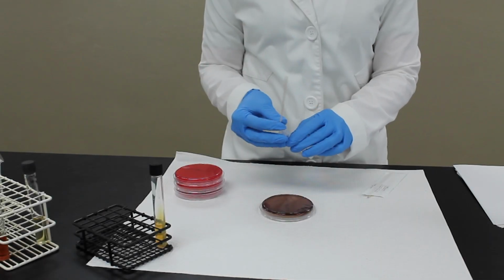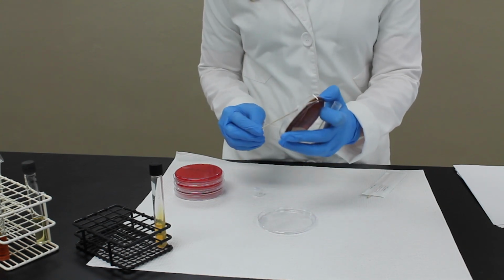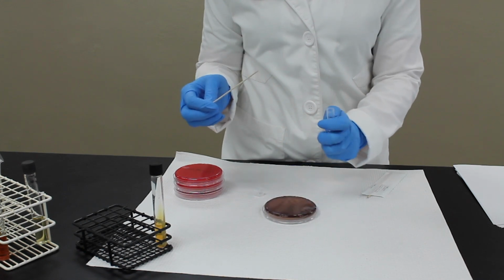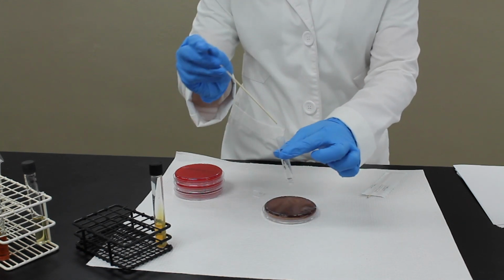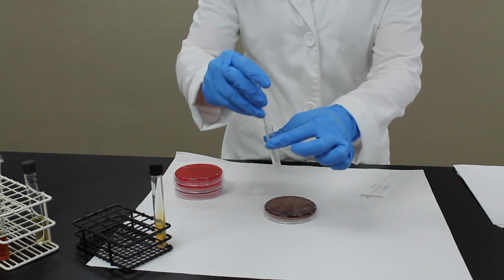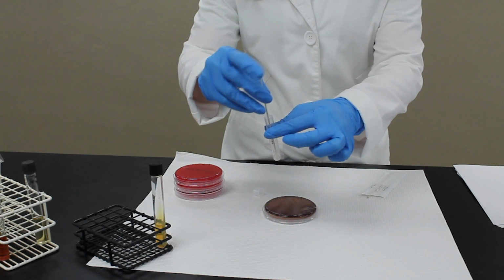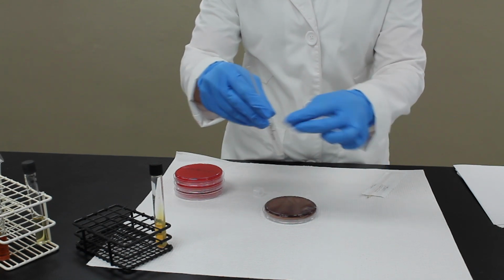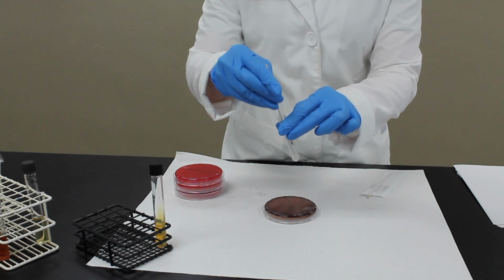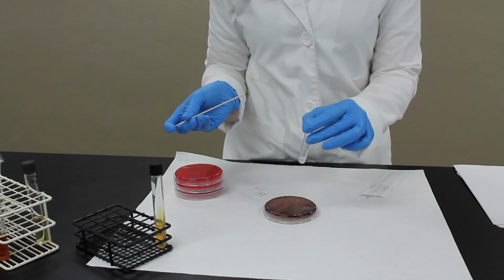So after we made our coagulase slide, we're going to do the same thing except inside the tube. We're going to take a colony off our blood agar plate and then put it directly into the rabbit plasma and incubate that for 24 hours. When you take it out of the incubator, if it's positive, it should be a solid clot. And it's incubated the same as the plates and the tubes, at 37 degrees Celsius.